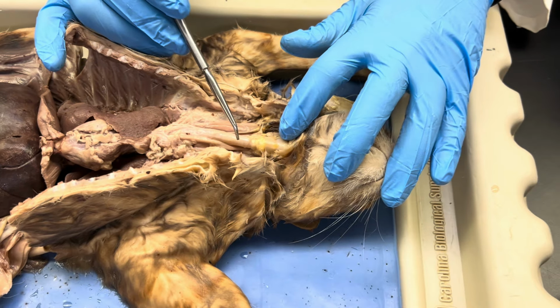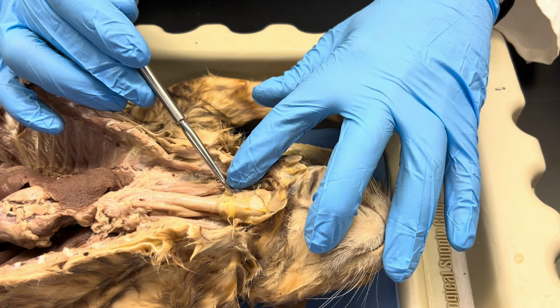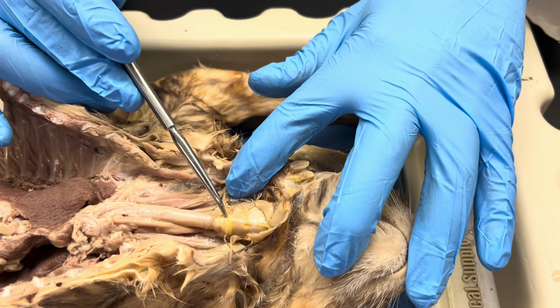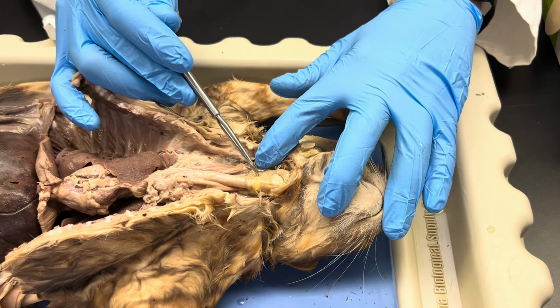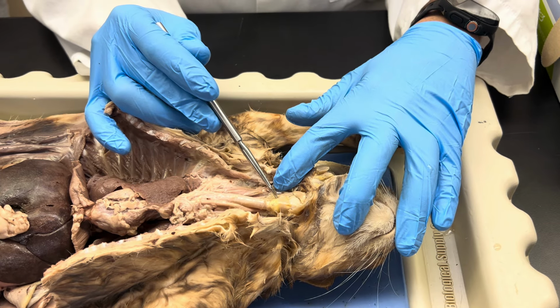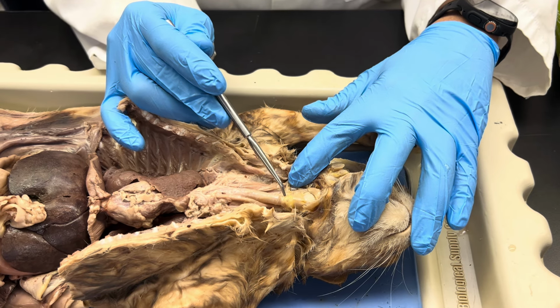Next, we have the thyroid gland. Well, this white cartilage that you're looking at, that's actually thyroid cartilage. And if you look just below it, see kind of how it has this yellowish, whitish, it almost looks like fat. That's the thyroid gland, actually right below it. All right, so you got the thyroid gland right through here, and that's kind of hard to keep, because it usually gets obliterated as you start to try to dissect out. If I was to clean up the larynx, the thyroid would go away. That's why I didn't clean it up completely.